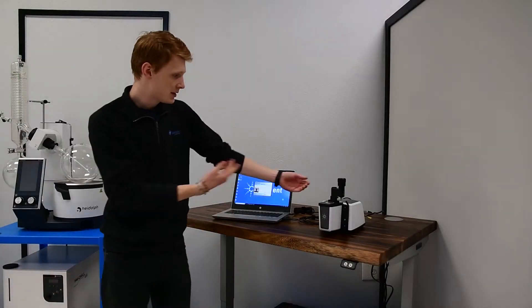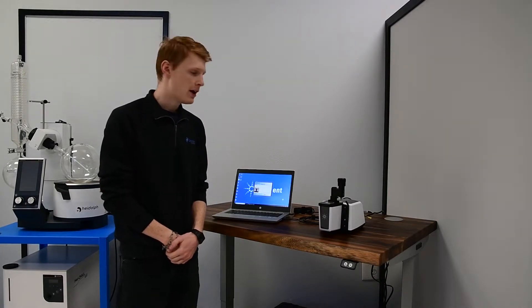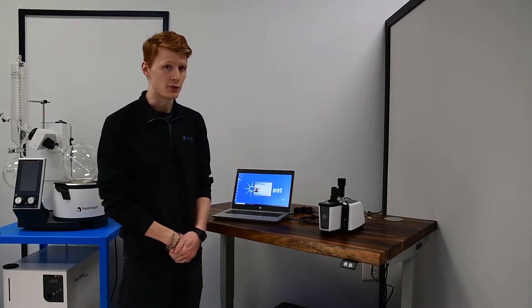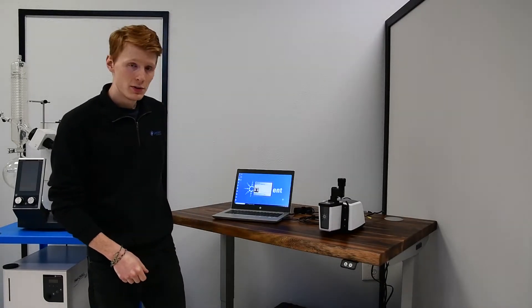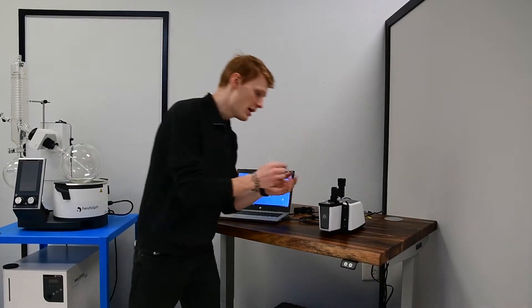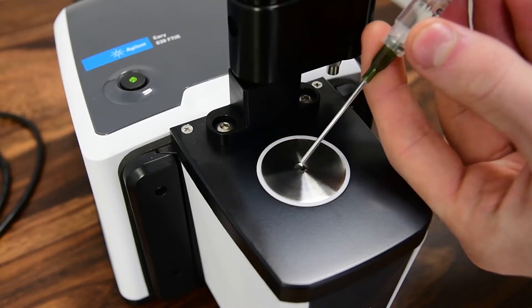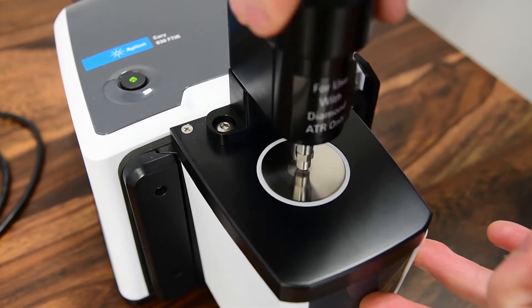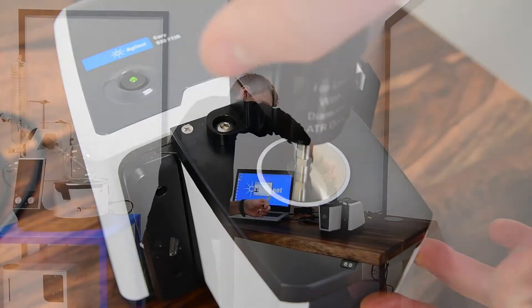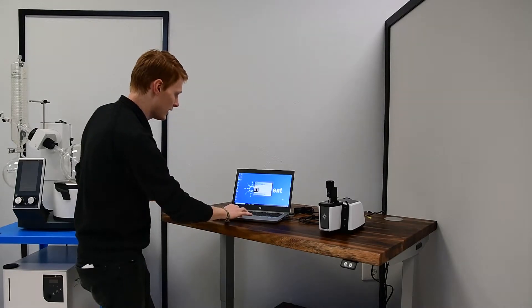This is the Agilent Cary 630 FTIR — that stands for Fourier Transform Infrared Spectroscopy Machine. What you do is take a little sample and just dribble it onto the diamond. You only need enough to cover this tiny, tiny sample area. You'll lock it down and from there you can take a scan.